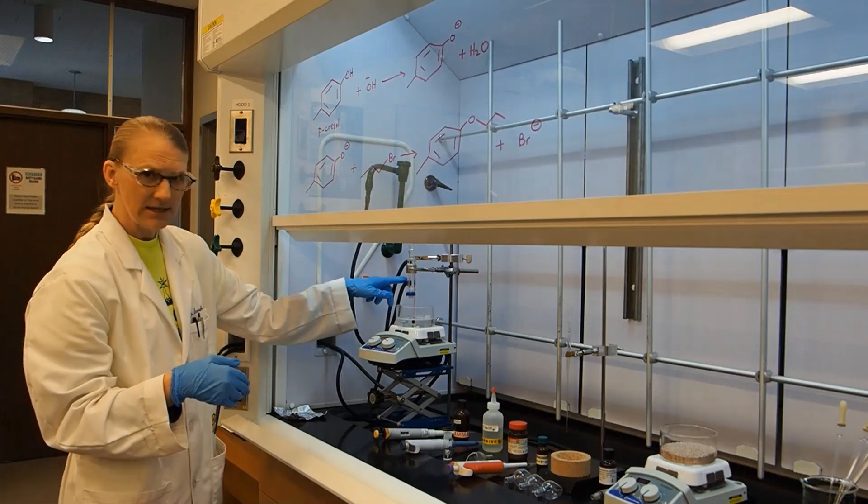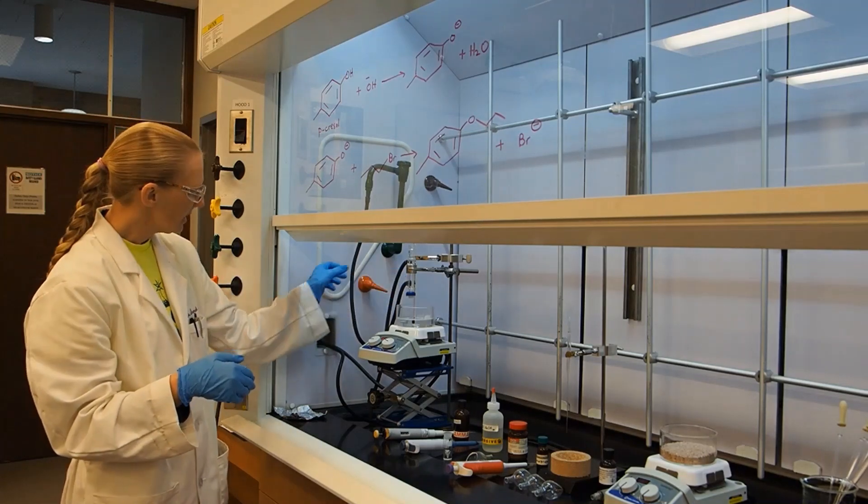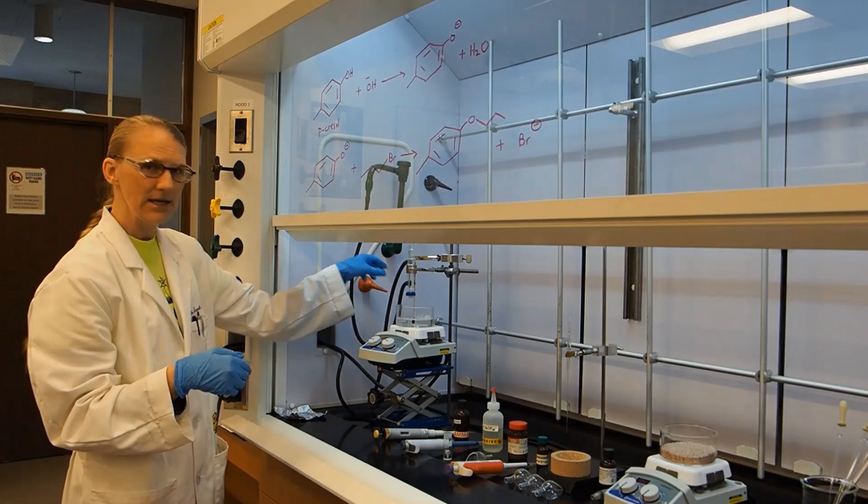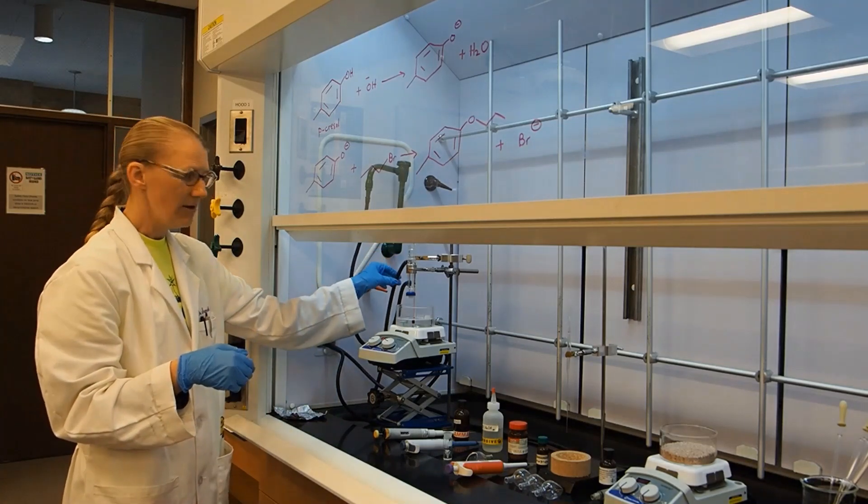The in tube is at the bottom, going to the faucet. The out tube is going to the drain, and I've already checked for leaks.